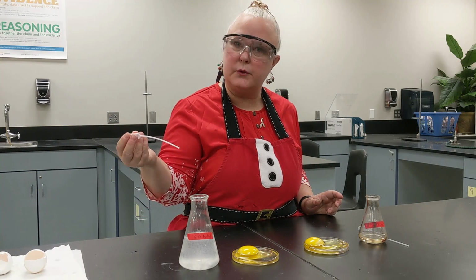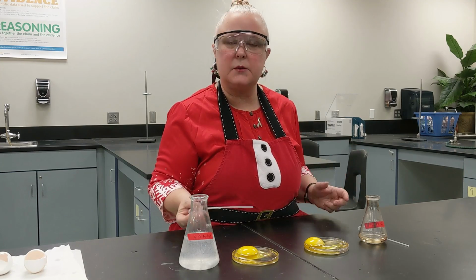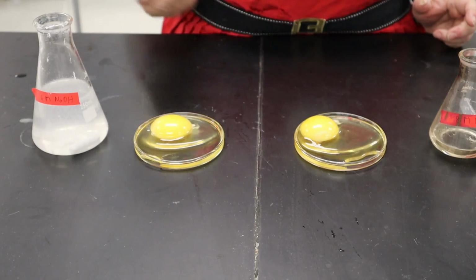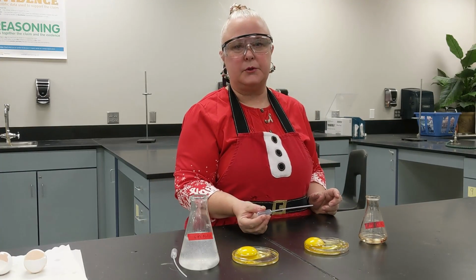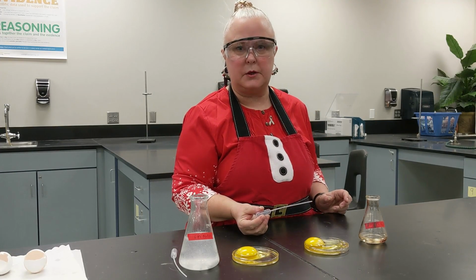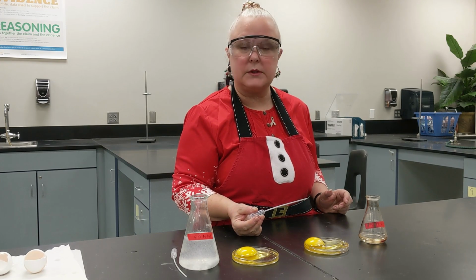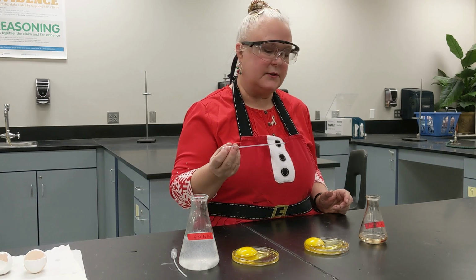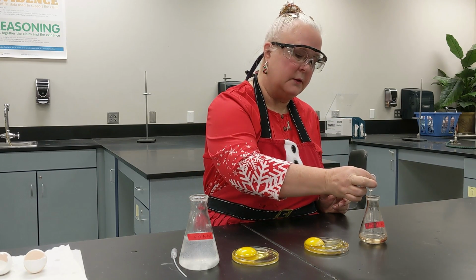So I'm going to show you, first of all, a little bit of acids and bases in your eyes. Let's see what happens. Anytime something in your eye starts to make it cloudy, as soon as that happens, you cannot change your eye back into being a perfect eye again. And usually in my class, it would take at least 3 to 6 seconds to get there. And so I am going to show you, the first one is with acid.